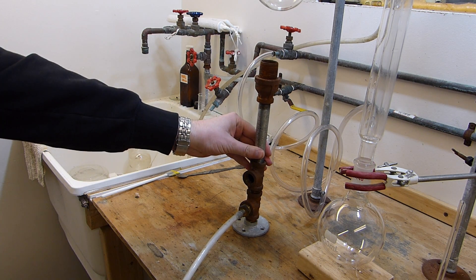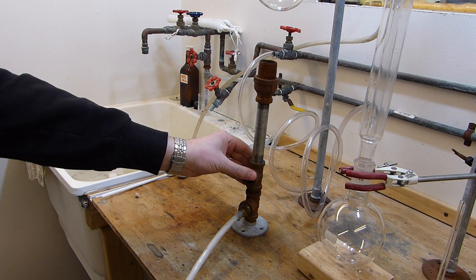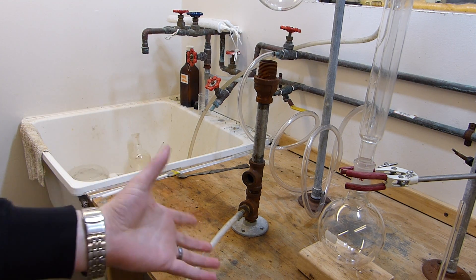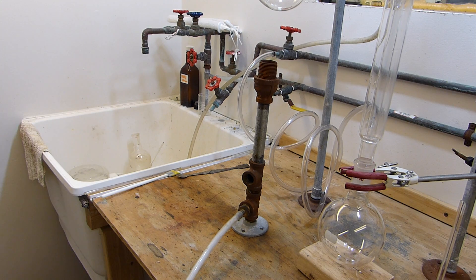While they will distill sulfuric acid, it only happens just barely. So I need to use a gas burner to get to the correct temperature and also to make sure that the distillation runs at a reasonable speed. And because my gas burner is so tall, I need to configure this apparatus vertically so that I can accommodate everything.